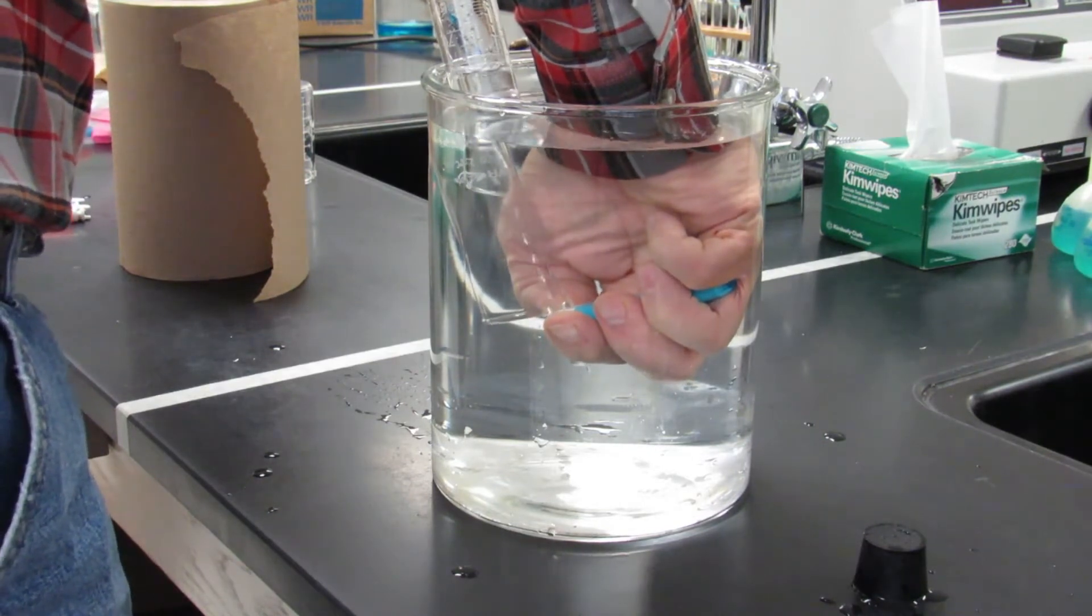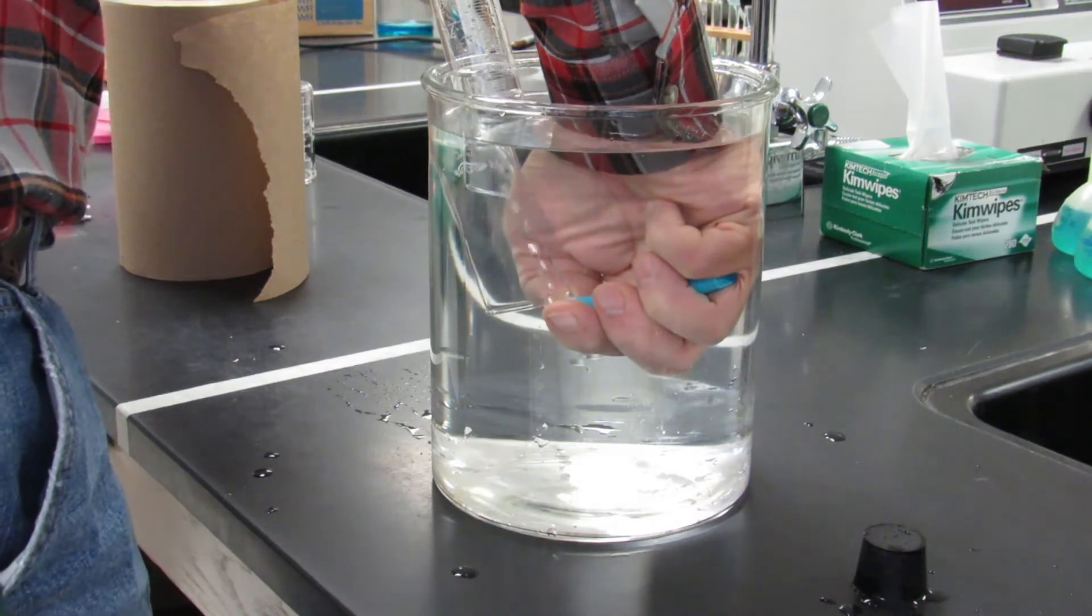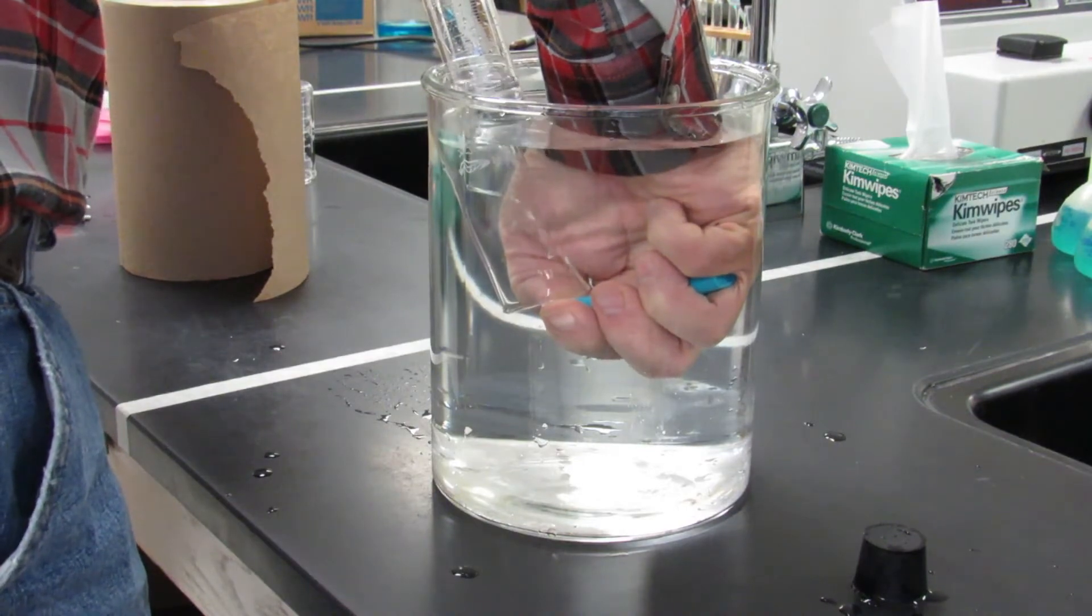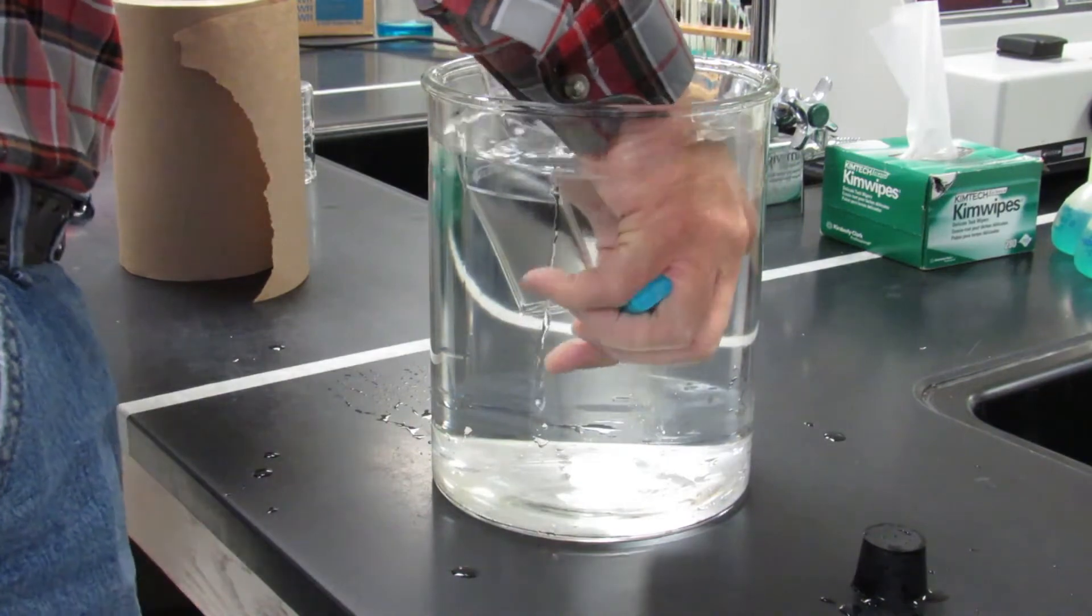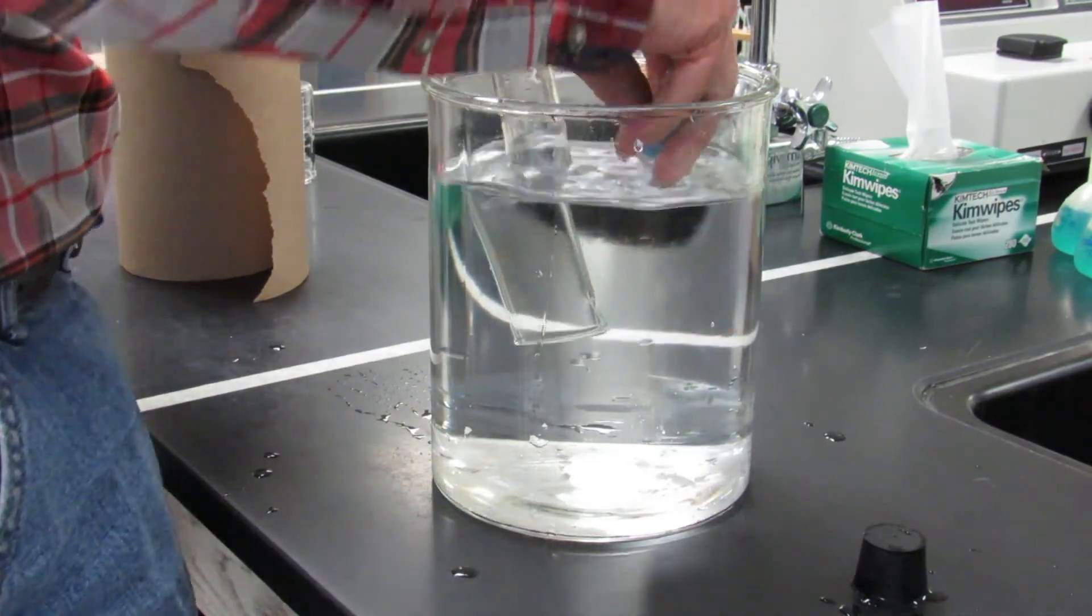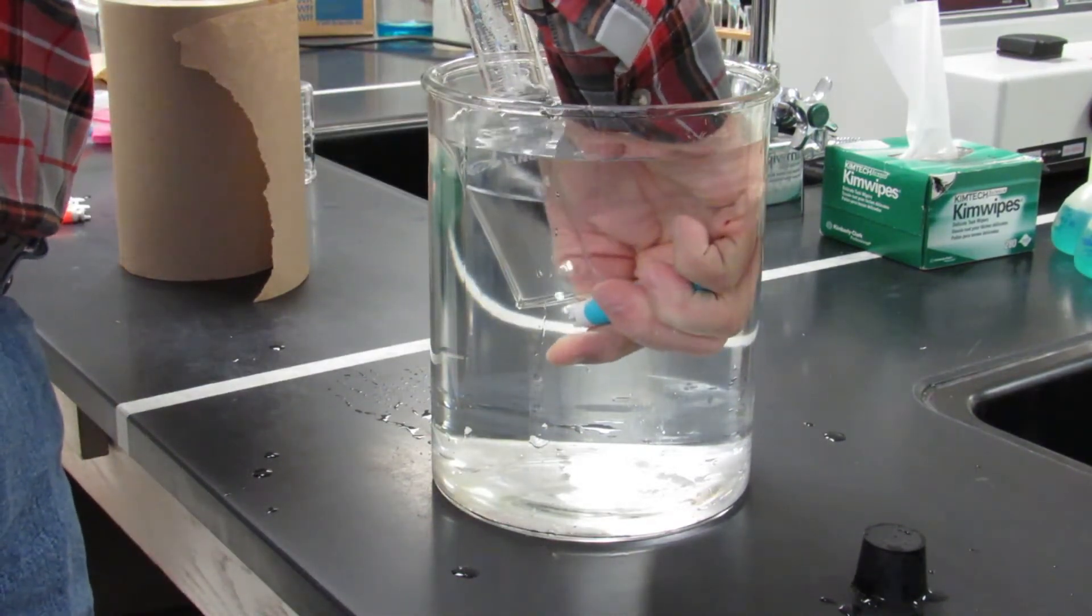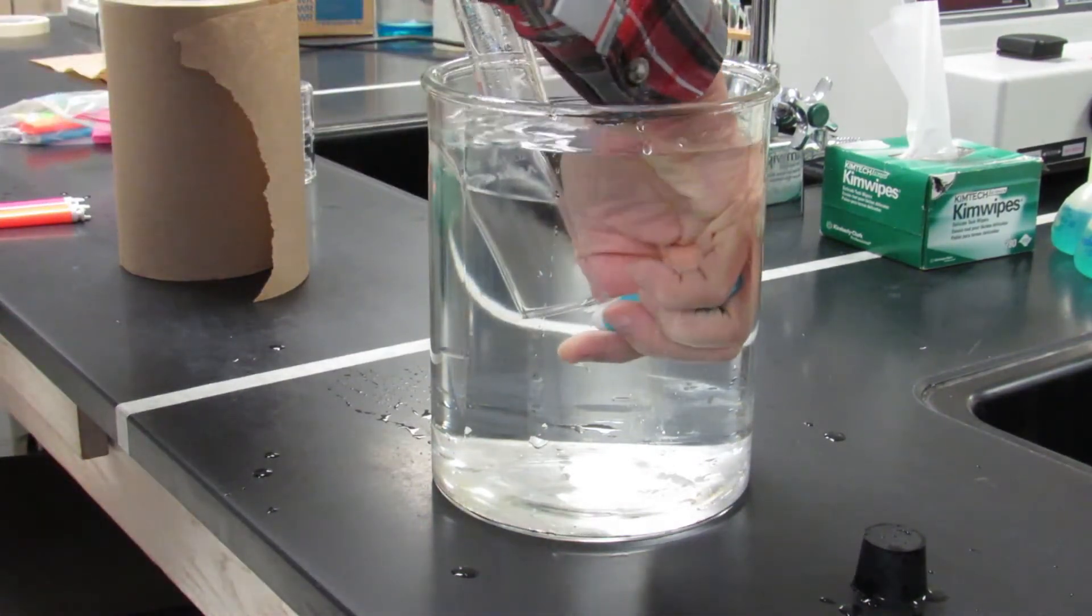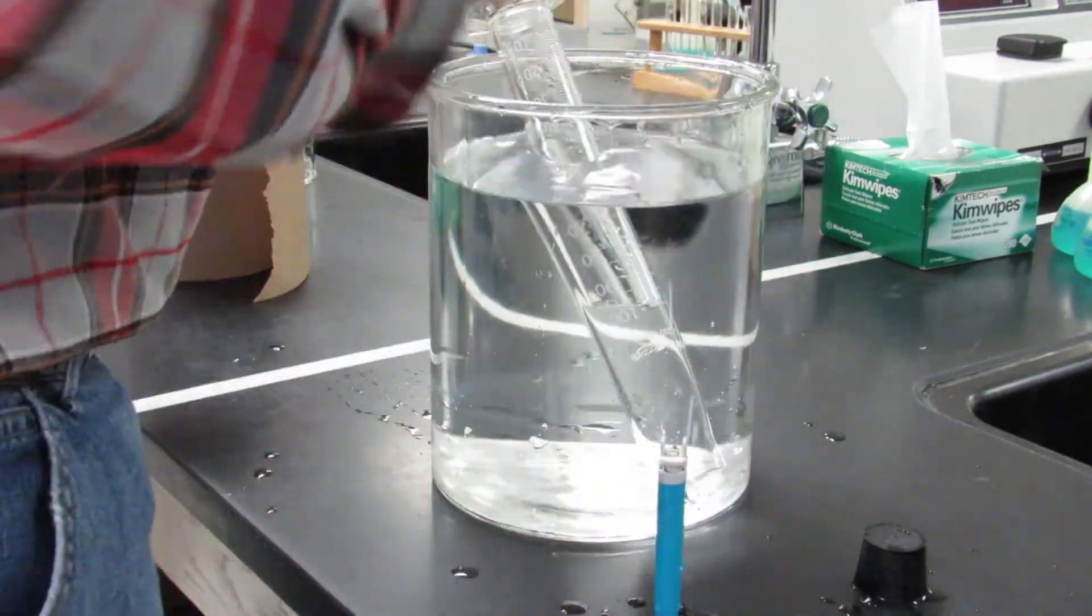Keep filling until it gets to 95 mL, and then I'm going to let it sit. The gas right now is being dispensed through this water. The water is a little cold, not crazy cold but a little cold, so I want to make sure that has room to expand as it gets a little bit warmer. I'm right now trying to make sure it's just above 95, that way I fill up a lot of it but I'm not going to go too far past it.